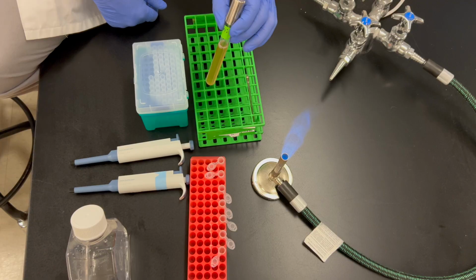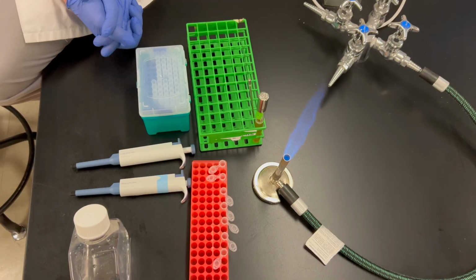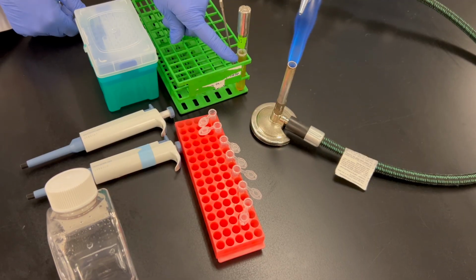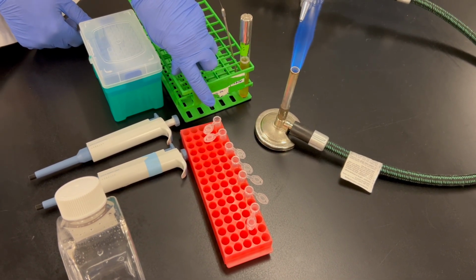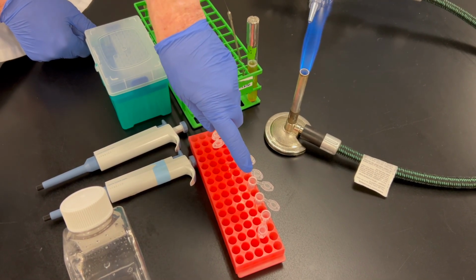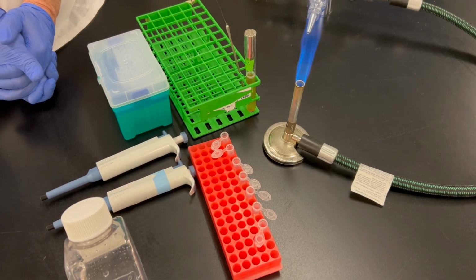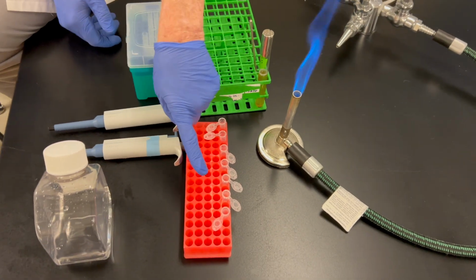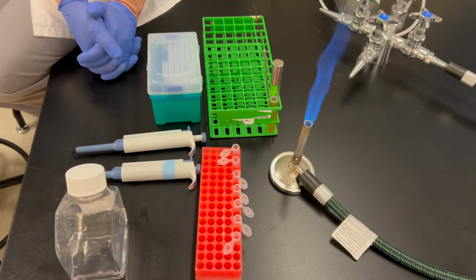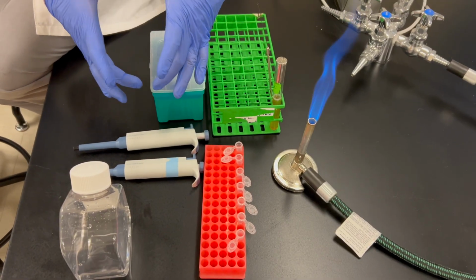To estimate the number of bacteria per ml in this tube, we're going to do a standard plate count. The first step of a standard plate count is called a serial dilution. The goal of a serial dilution is to take a sample of the bacteria in here, add it to water and dilute it again, and again, and again, all the way down through these 7 tubes until we get approximately between 30 and 300 bacteria in 200 microliters of a single tube. We will then take 200 microliters from that tube and place it on a bacteriological plate.